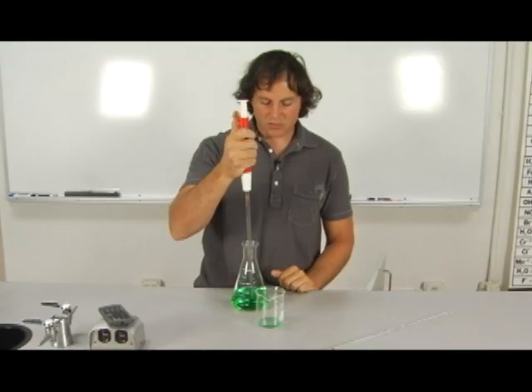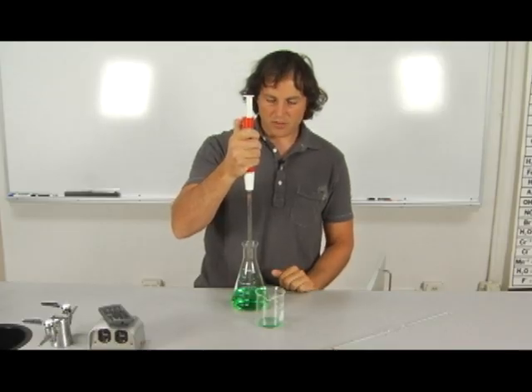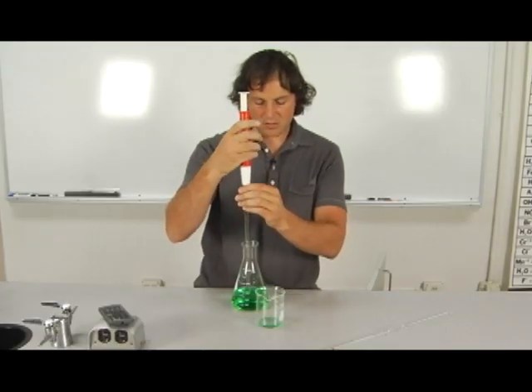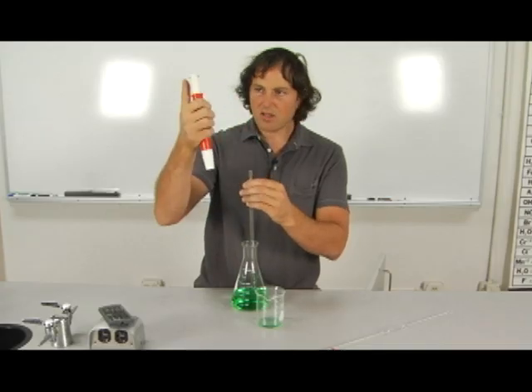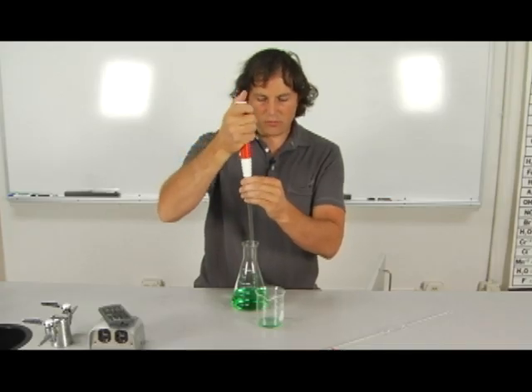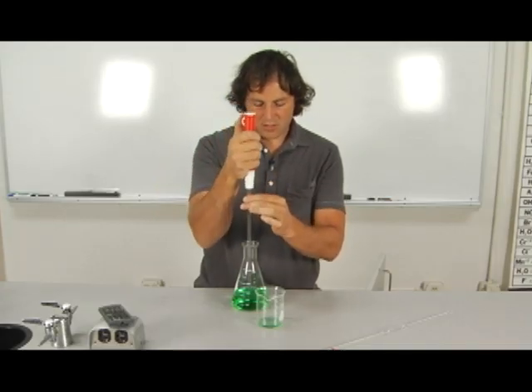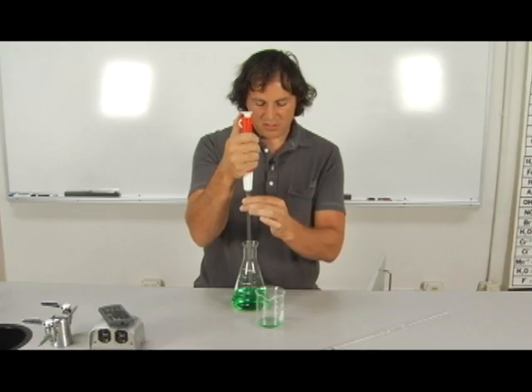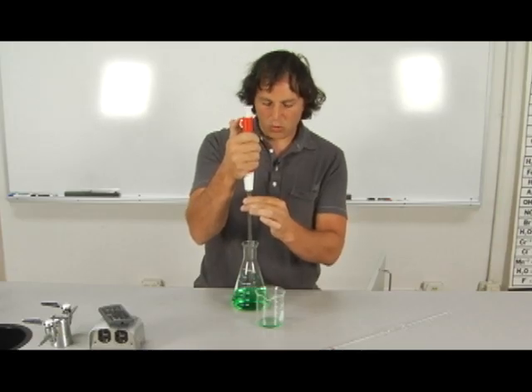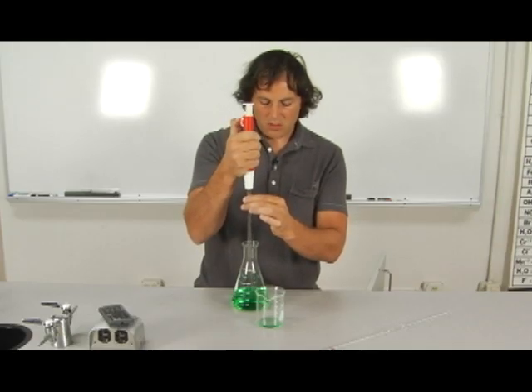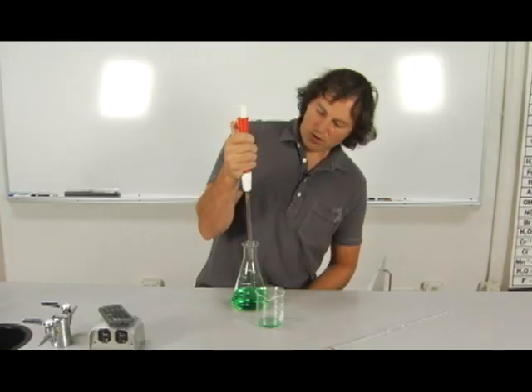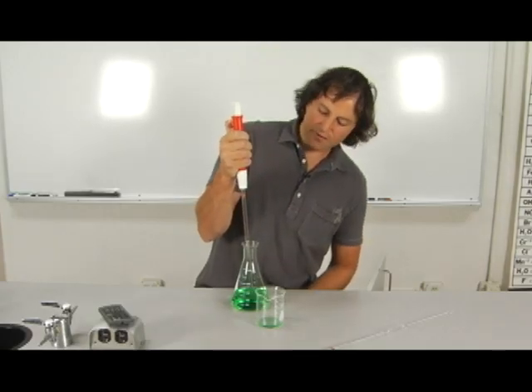So same function, Mohr pipette. What you'll find with the Mohr pipette is it's going to take a lot more movement of the thumb because this is all like one large bulb. You'll draw and there's a lag factor.